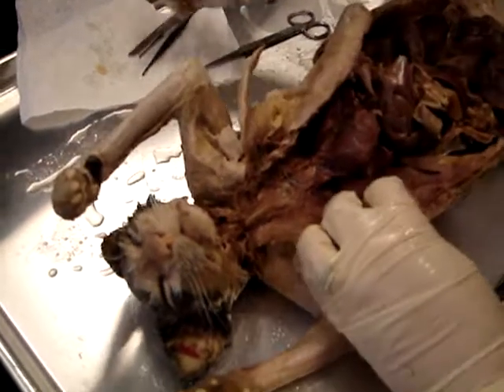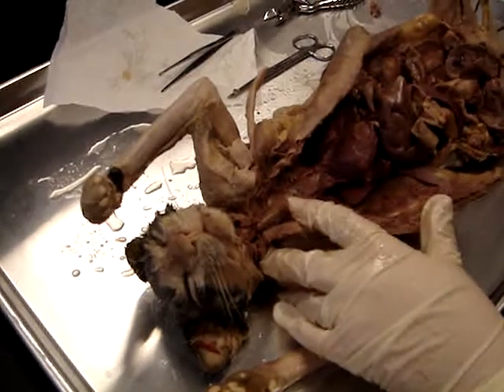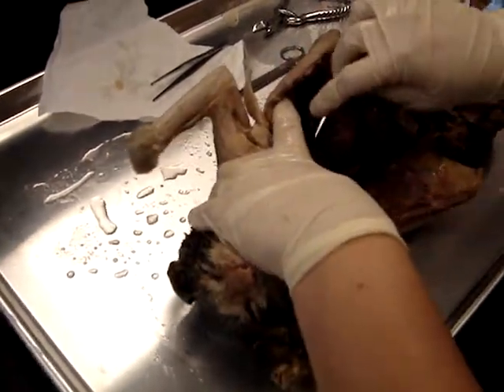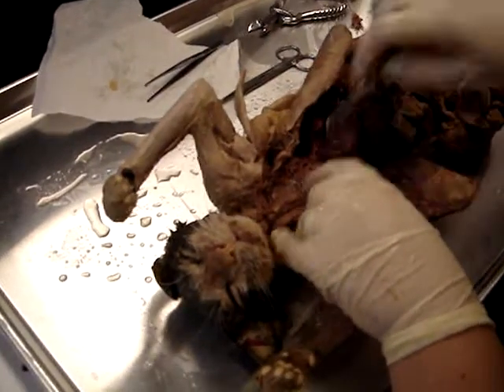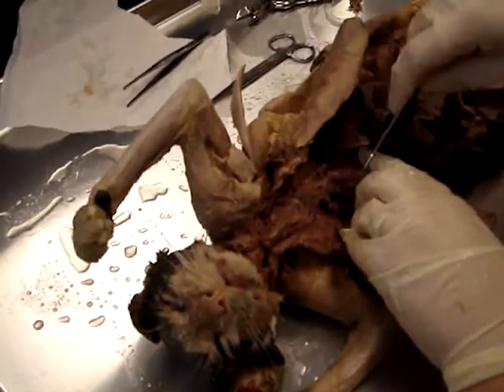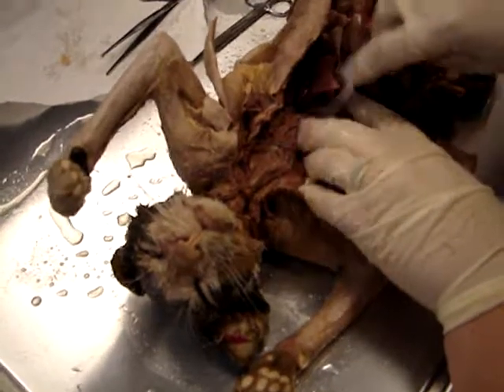Okay. So let's go through the... So somebody put a cat vessel list in front of me so that I can make sure I don't skip anything. So next page. All right, so from the top of the heart, let's do the arteries first. So it's arranged into thoracic arteries and then abdominal arteries, okay?